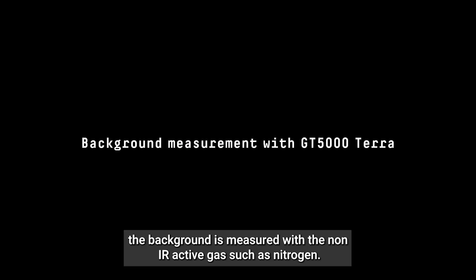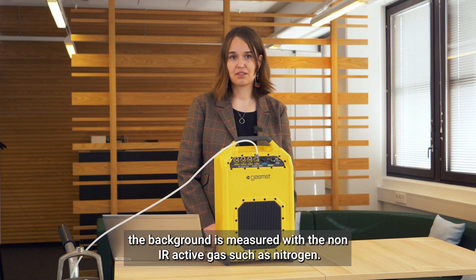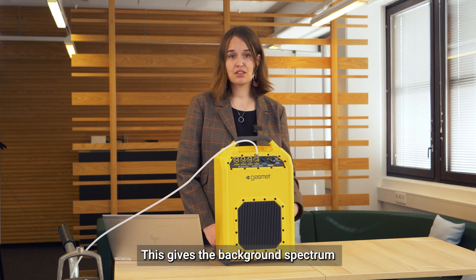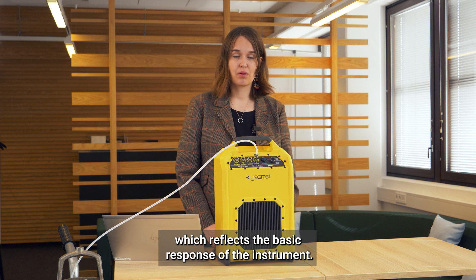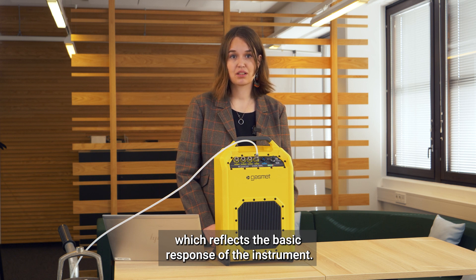For FTIR analyzers, the background is measured with a non-IR active gas, such as nitrogen. This gives the background spectrum, which reflects the basic response of the instrument.